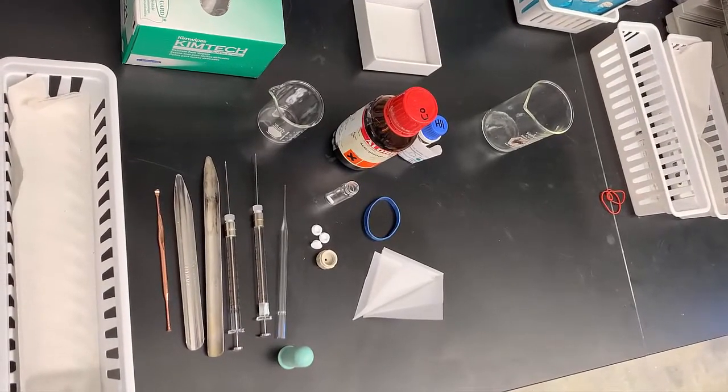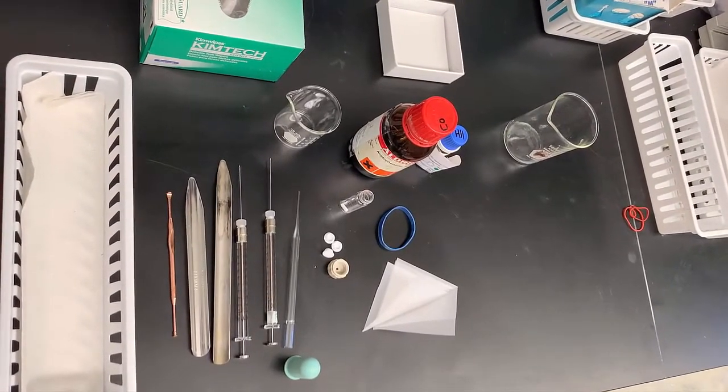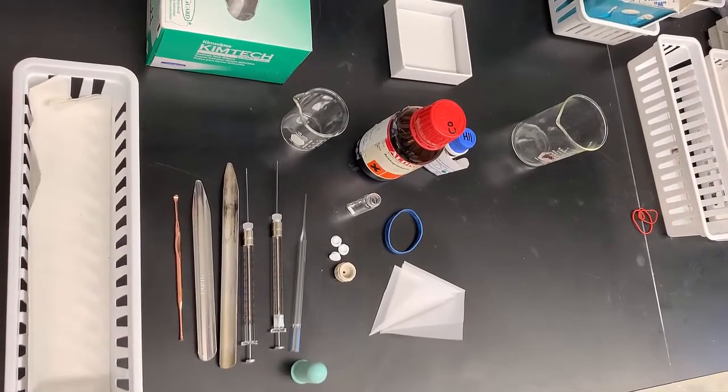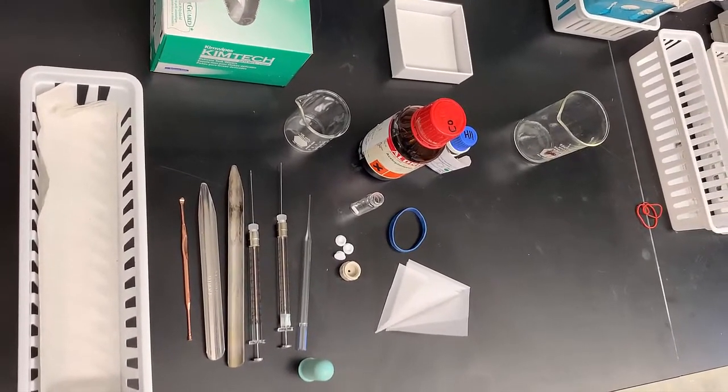To enter the glove box, you need a few items every time in order to properly use and measure chemicals.